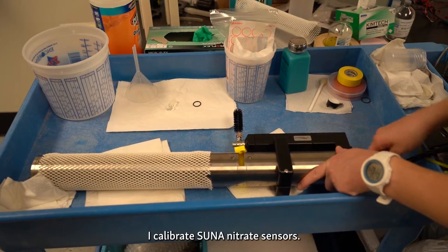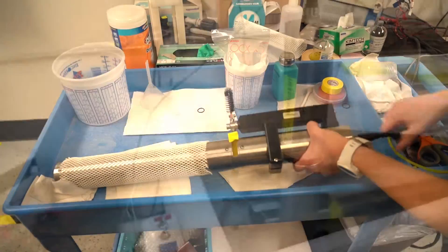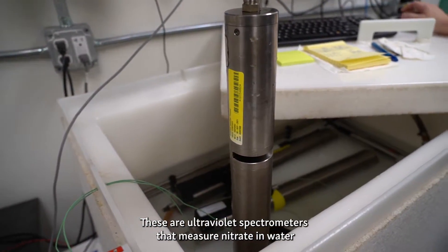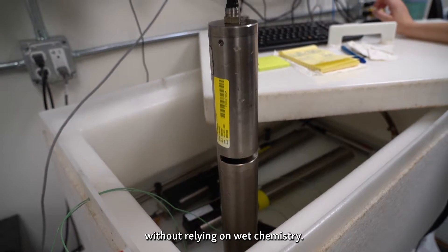Hi. My name is Kelsey. I calibrate SUNA nitrate sensors. These are ultraviolet spectrometers that measure nitrate in water without relying on wet chemistry.